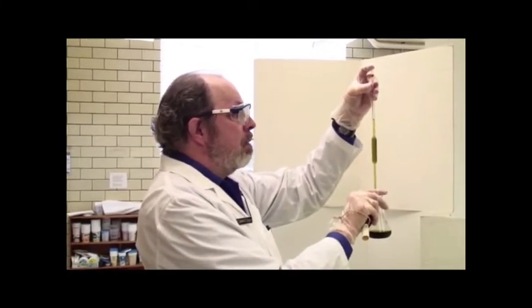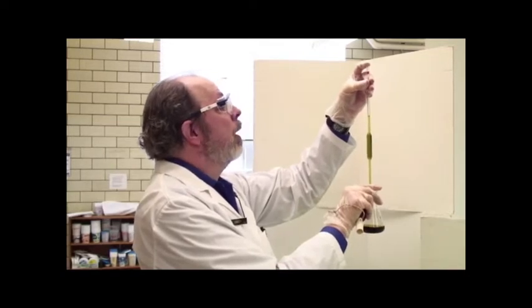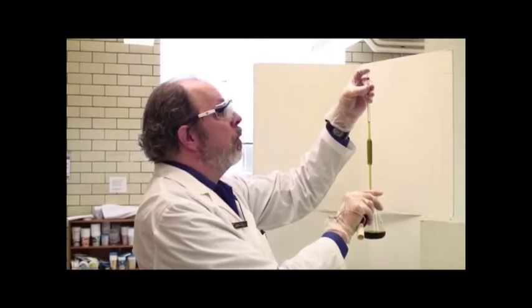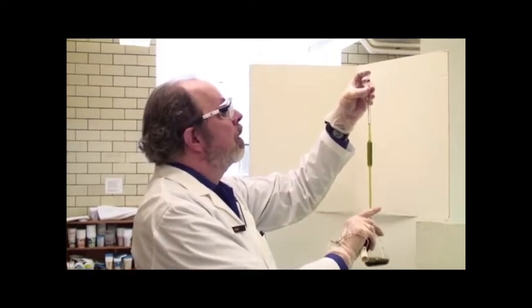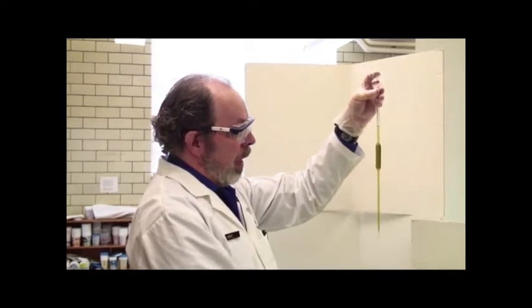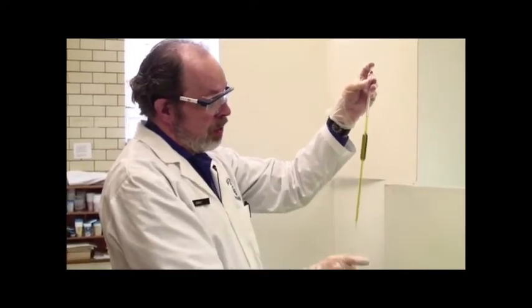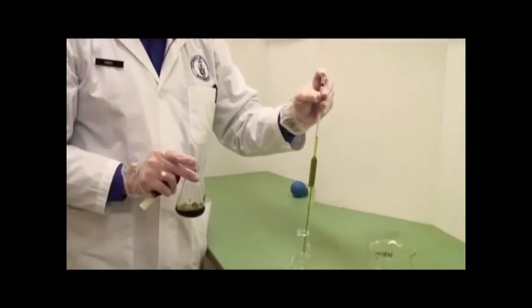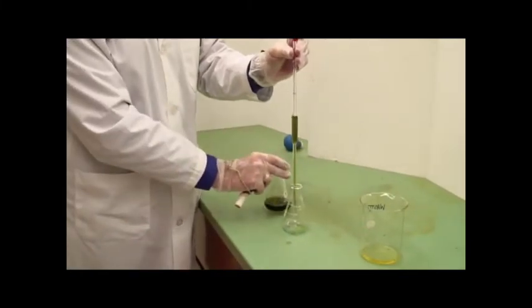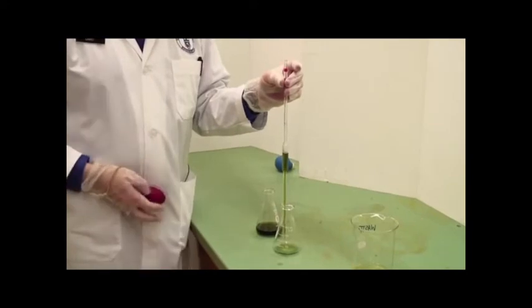Hold it so that it is level with your eye, so that you are seeing a line and not a ring. And by releasing pressure with your finger, you get the top of the meniscus down to the line. That's now ready to go. If there's a drip on the tip, touch it to the dispensing vessel, place it over the receiving vessel, and allow to flow out. Do not squeeze it out at this point.